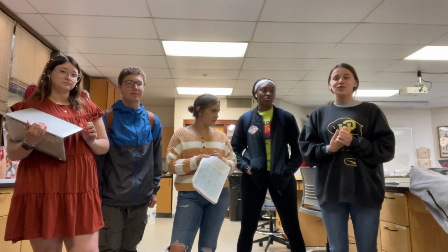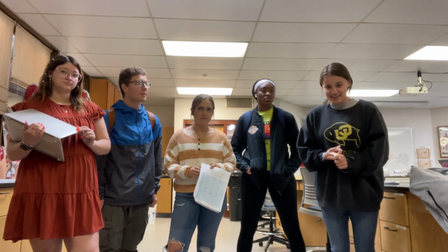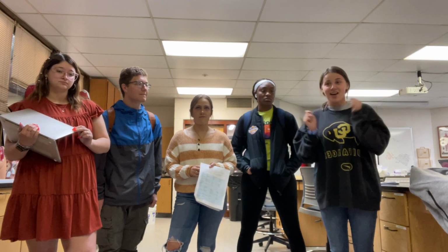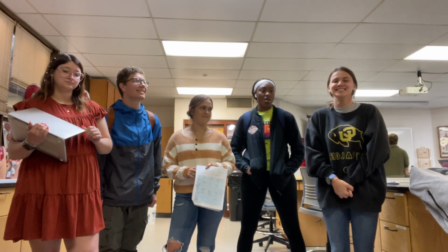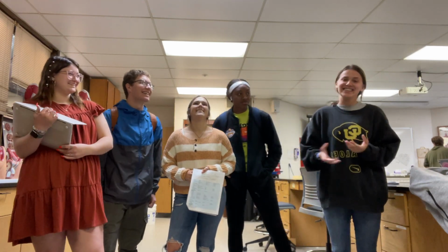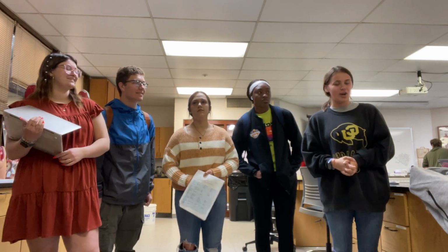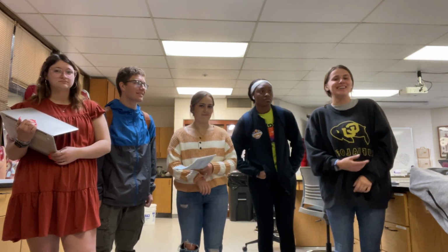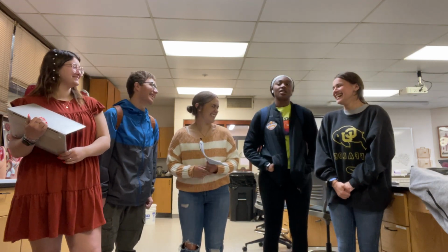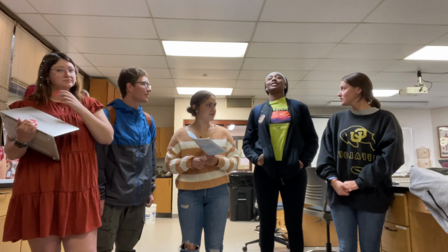The heart has 4 parts to it: the sinus venosus, the atrium, the ventricle, and the bulbus arteriosus. Anyways, we were not surprised, but we observed the contrast in the type of circulatory system and thought it should be noted. Thanks. Another huge difference I will talk about is the excretory system.